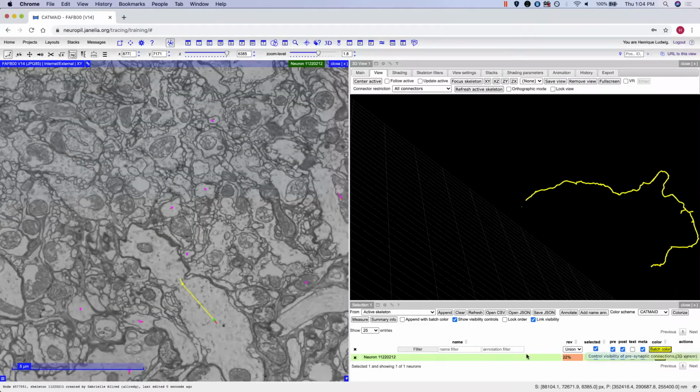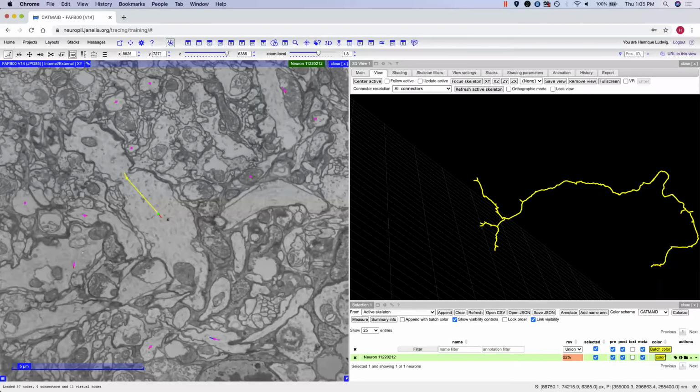There you go. Now you can refresh your screen and you will see the portion that was merged onto your skeleton. Now let's say that this merge was not actually correct, and these two skeletons should not have been merged together. You can split these two skeletons by pressing on the scissor icon at the top of your screen.